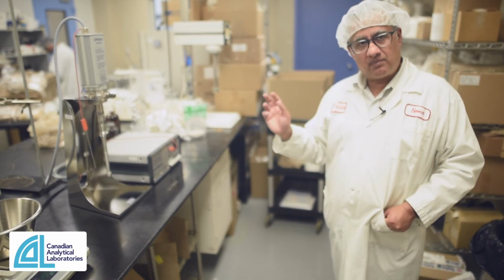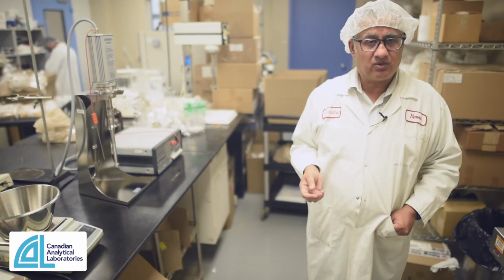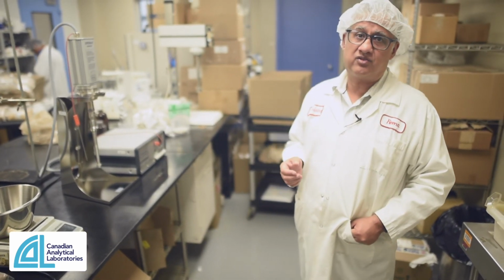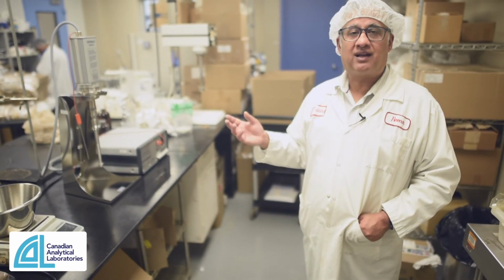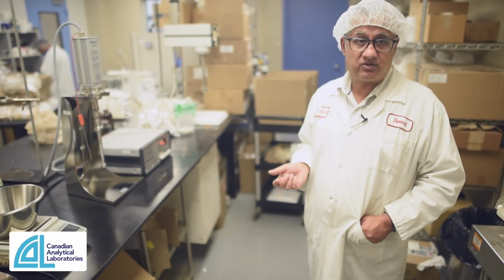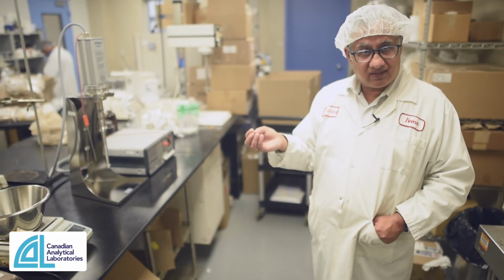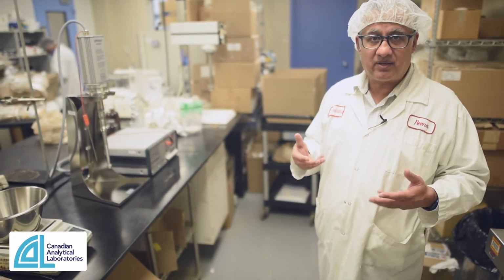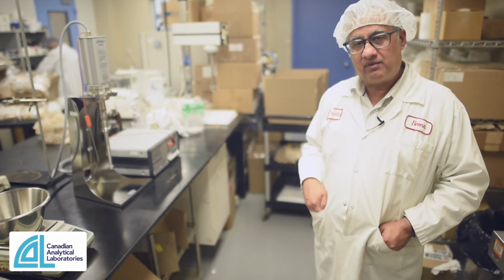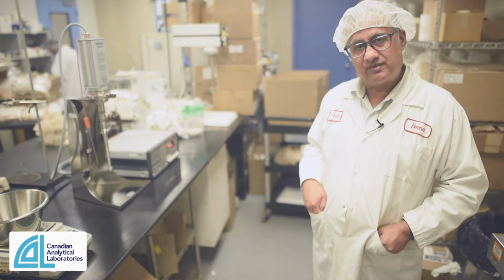You take these upstairs to the lab and then submit them to all of those different analytical techniques that you were shown. And this gives us a really good feel for how botanicals behave in finished dosage formats, actually seeing the physical herbs and the different excipients in this lab helps us really with the development of our assays upstairs.